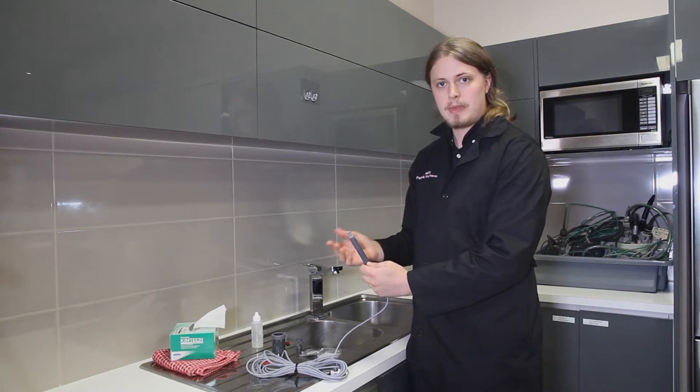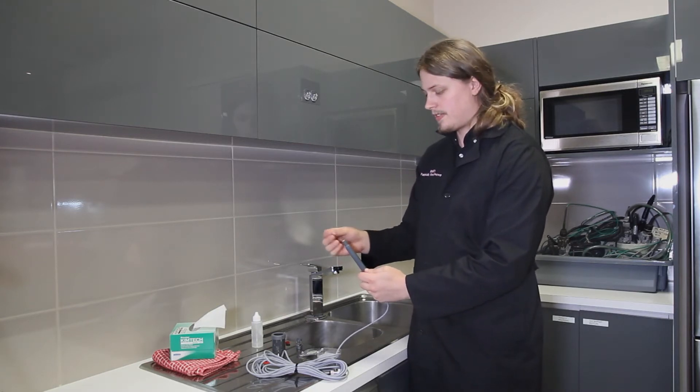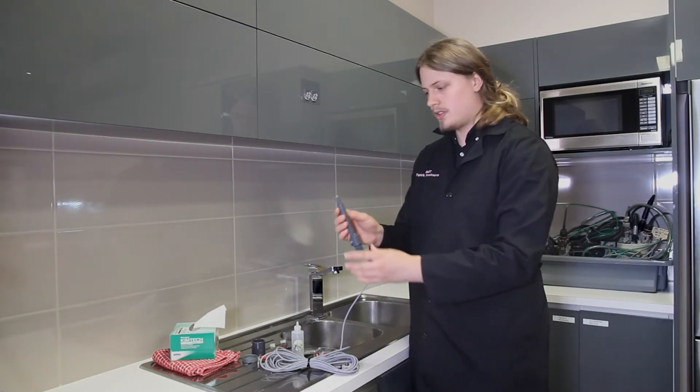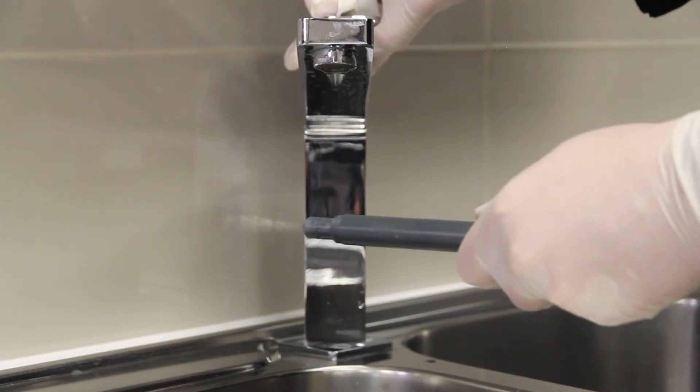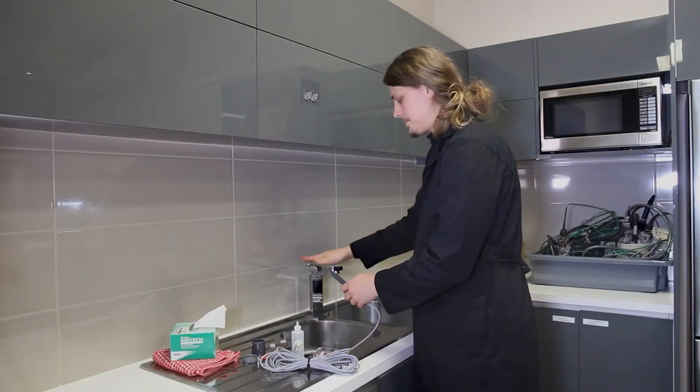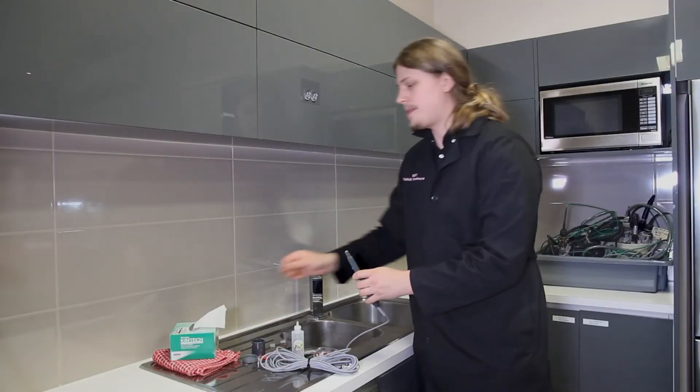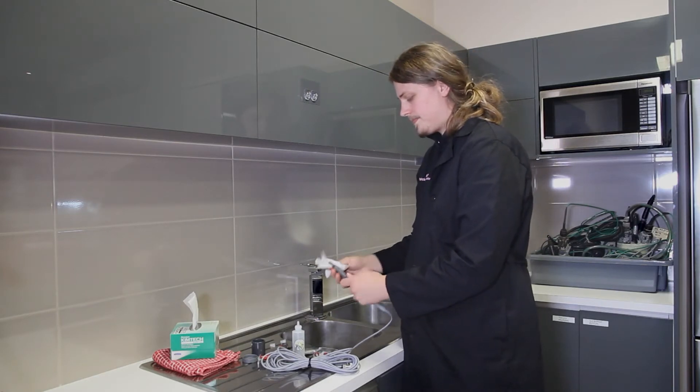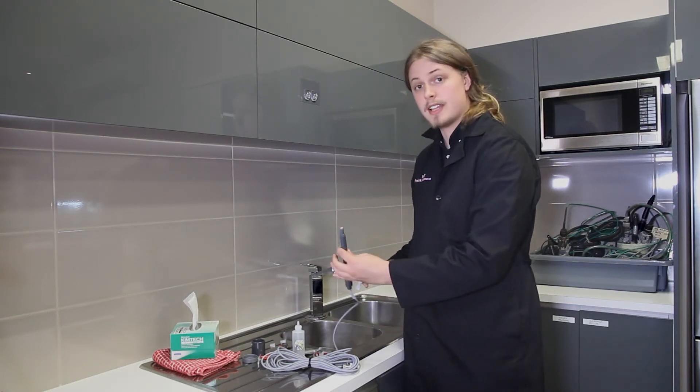Finally, remove the old membrane and place it aside. Next, give the tip of your sensor a quick rinse under the tap with water to remove any old electrolyte. Then take a tissue, dry it off, and your sensor is ready to go.